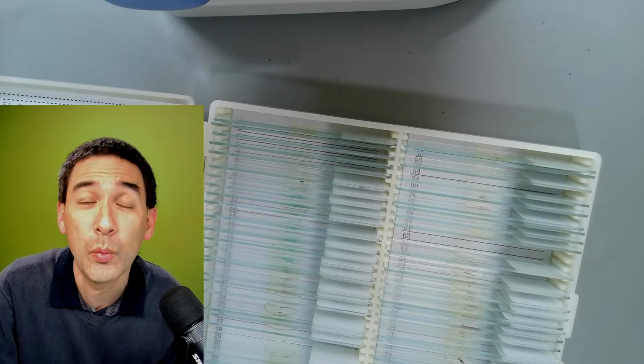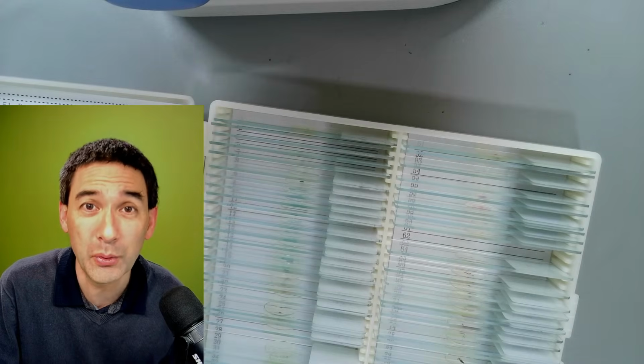We're just playing around a little bit and experimenting. And I remember, I did not show that to you, my very first digital camera that I connected was actually a webcam. It was a 640 by 480 webcam that I put into a plastic box and connected directly to a microscope, and then used the optics to directly project the image onto the sensor.